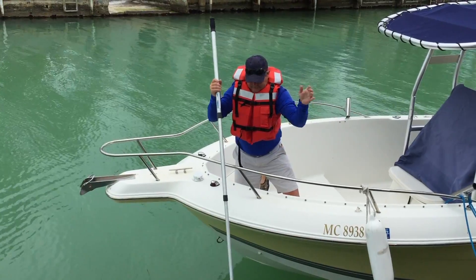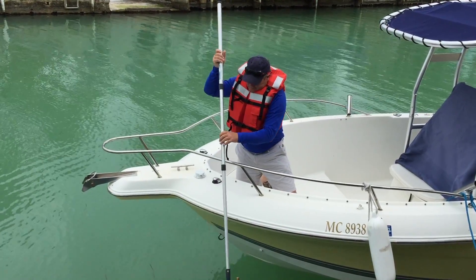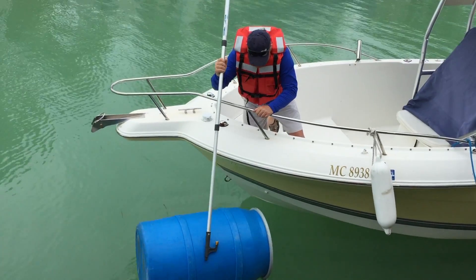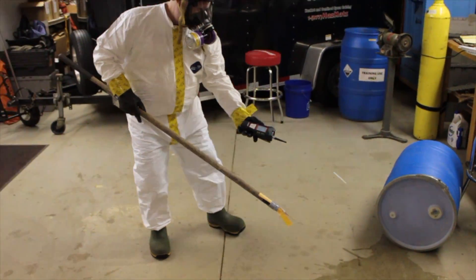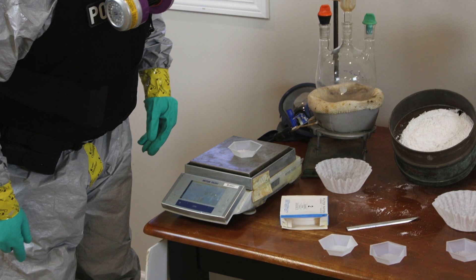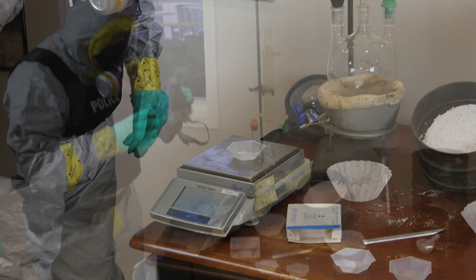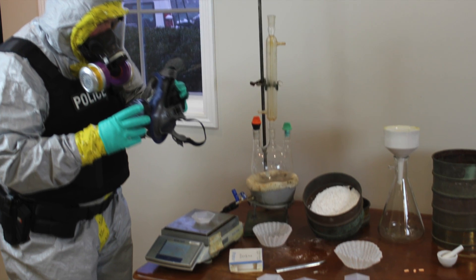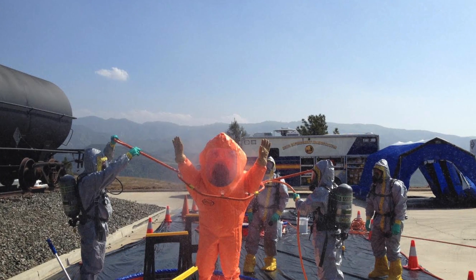Hello, my name is Dean Blosser from Hazmat Solutions. Whether you're collecting a drum from a hurricane, testing a spill at a factory, or trying to identify precursors at an unknown drug lab, there are some simple tests that you can do to determine the degree of danger associated with any unknown liquid spill.